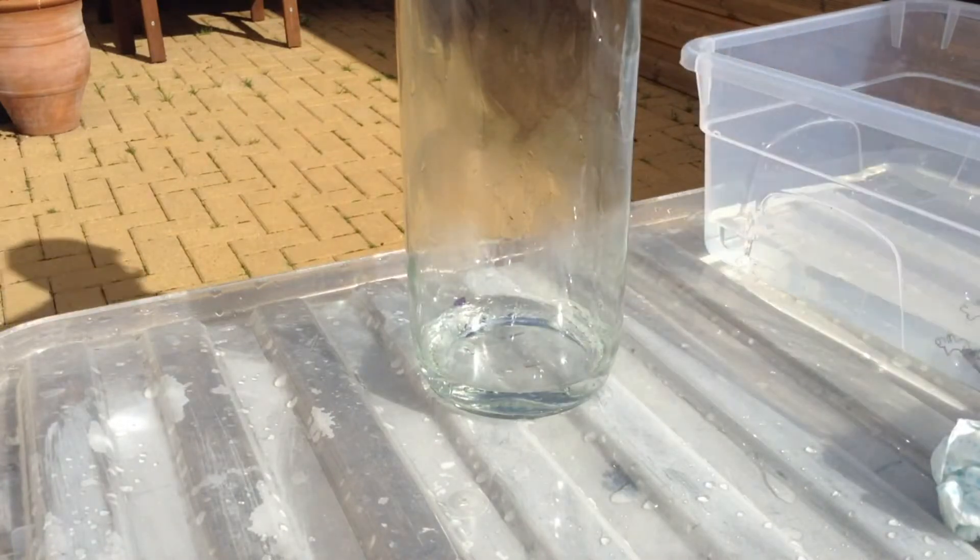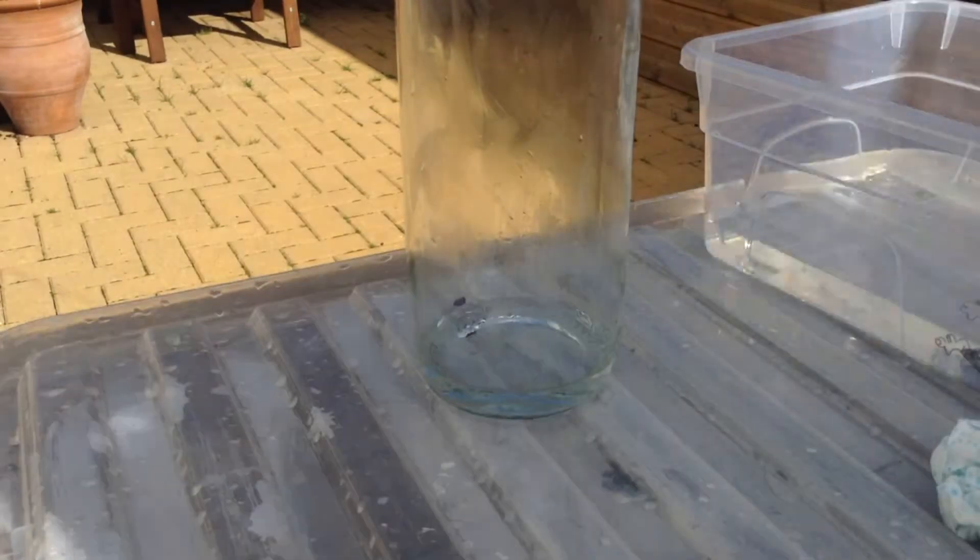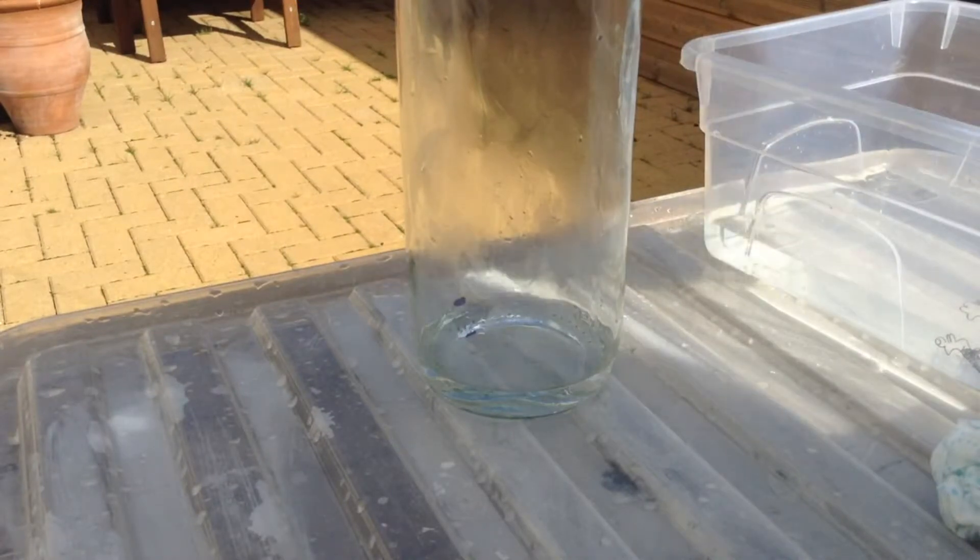To a glass container I added about 42 milliliters of hydrochloric acid which I'm doing outside as you can see and this is because the HCl is highly concentrated and fumes up quite a bit.